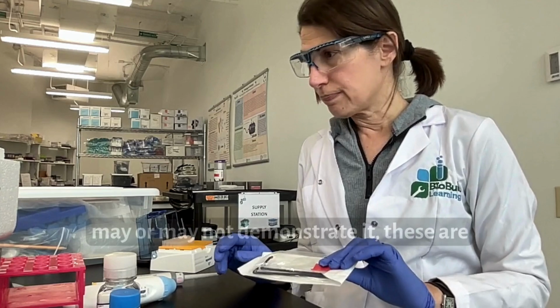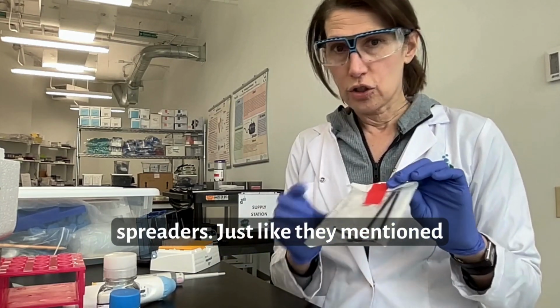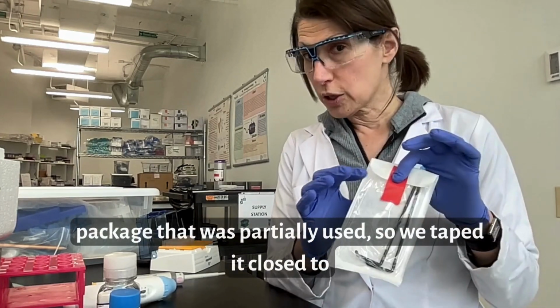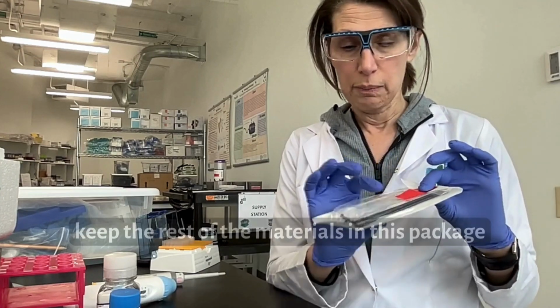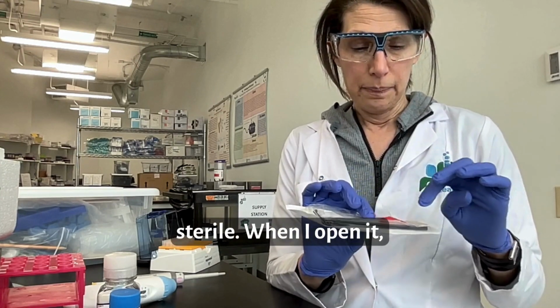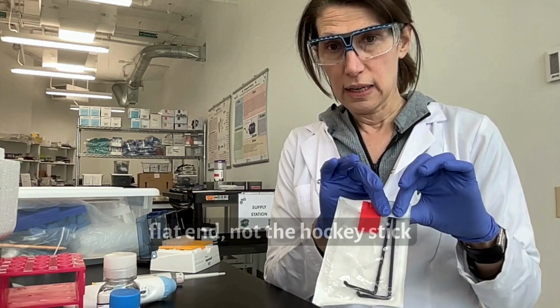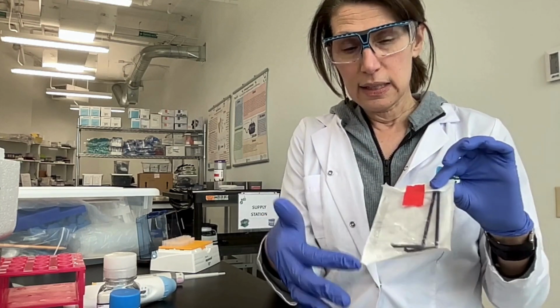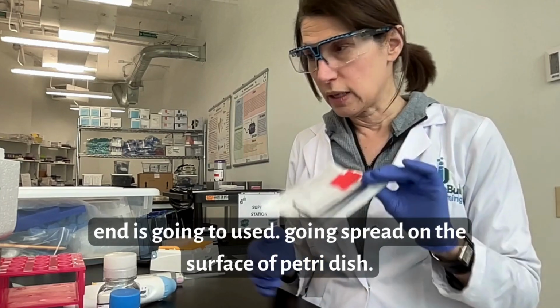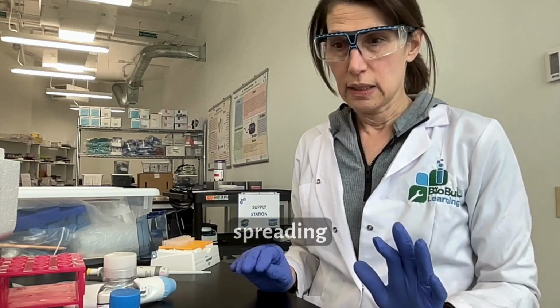And then, although I may or may not demonstrate it, these are spreaders, and just like they mentioned in that video from Carolina, we have a package that was partially used, so we taped it closed to keep the rest of the materials in this package sterile. But when I open it, I will open it from this end and touch the flat end, not the hockey stick end, because the hockey stick end is going to be used to spread on the surface of a petri dish. Okay, so let me demonstrate.